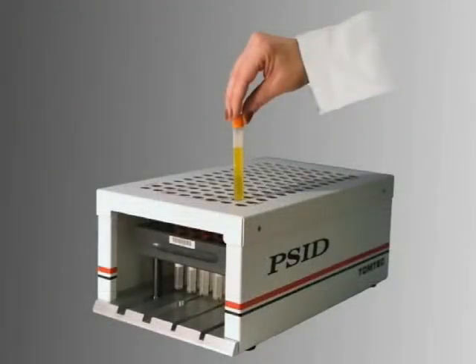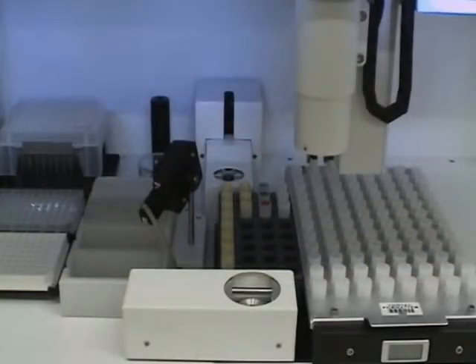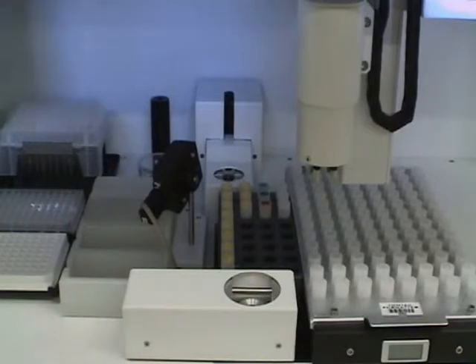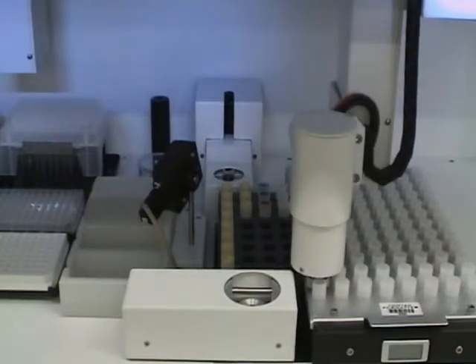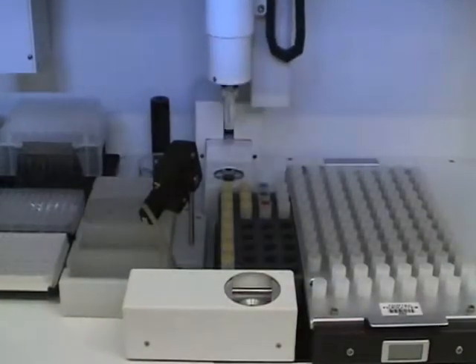The use of Tomtec's PSID can assist in that process. If all samples including standard, QC, blank, and the unknowns are barcoded, then they can be placed in the racks in random order. The formatter hand retrieves the next vial in line, reads the barcode, and accesses the LIMS with that barcode number for the processing data.